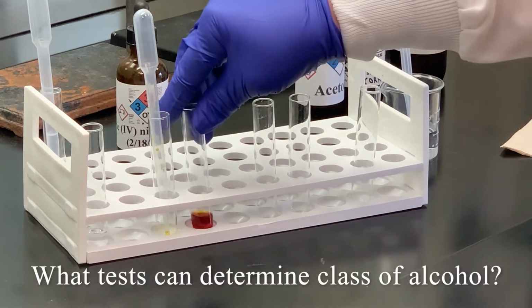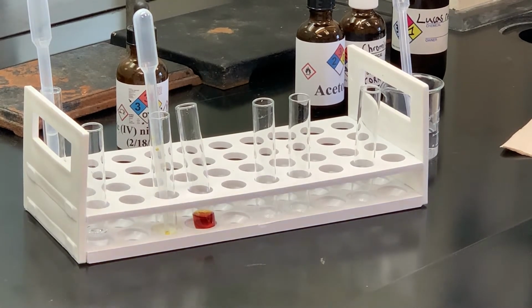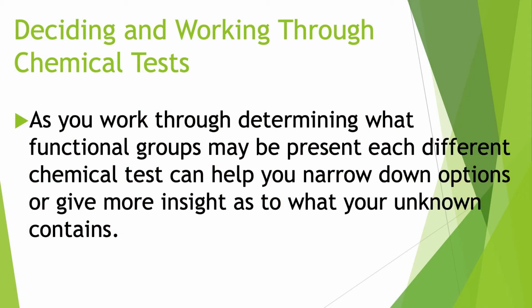So what we're going to do now is, well, what other tests can we use to determine what class of alcohol it is? Is it primary, secondary, tertiary? So the next test I'm going to move into would be chromic acid. Remember, once you start, each test will narrow it down perhaps to another functional group or isolate it to a more limited number of functional groups that's possible.